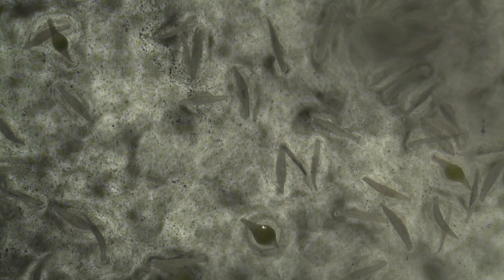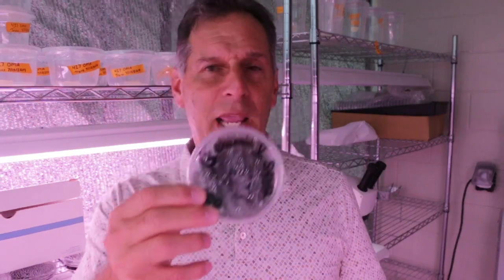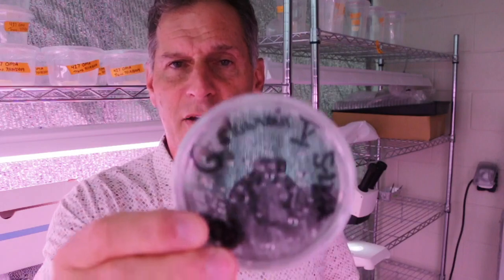Previously I wasn't able to get anything from this species, but this time out of a few capsules I can see some developing embryos. After ten days the embryos are much easier to see — they're enlarged a little bit and cream-colored to yellow to green in coloration. From at least this one capsule I'm going to be getting thousands of plants. I saved the seed so I'll plant some more, even though I'm not sure I need over a thousand plants of this.